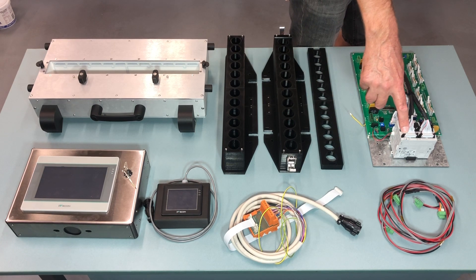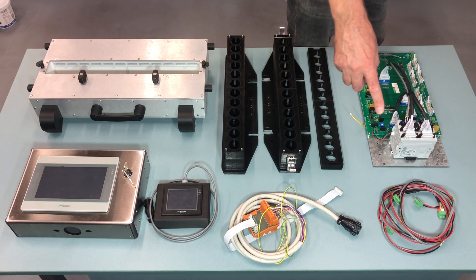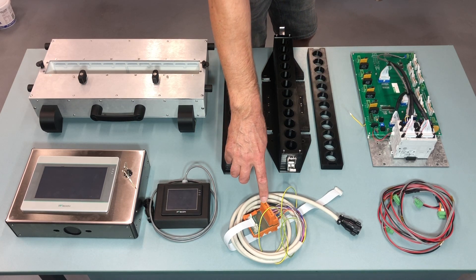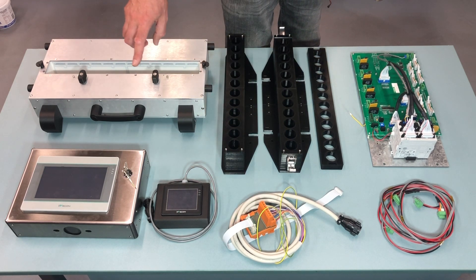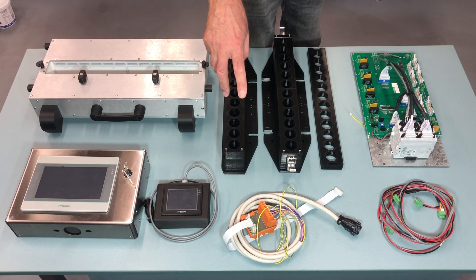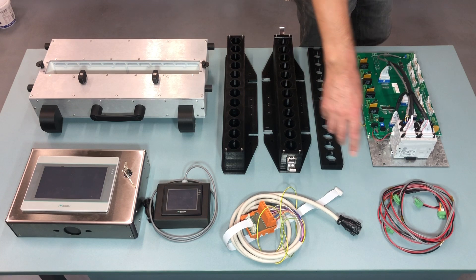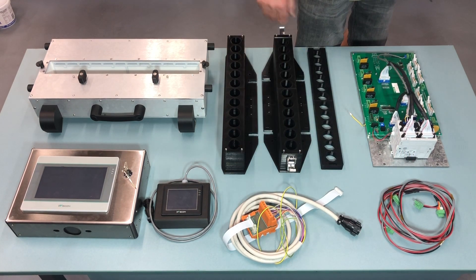This is a test cable that you can use for testing the HMI without having to remove the old one. I will send it with a terminal block and a ribbon cable so that you can test the counting head without having to remove the original cable. So that's just for convenience. After installation you can return this cable and the terminal block with the ribbon cable to me.